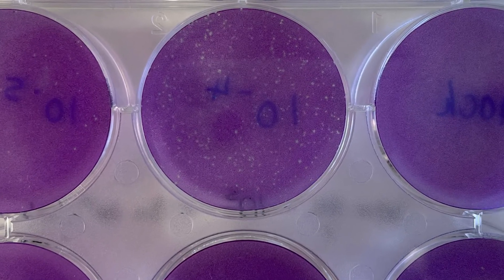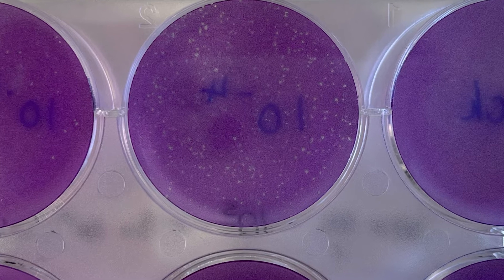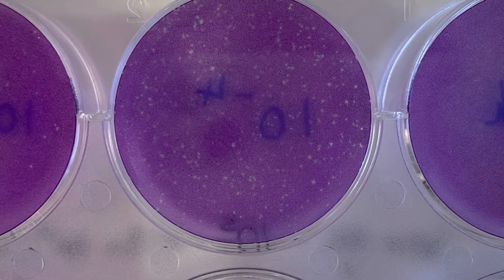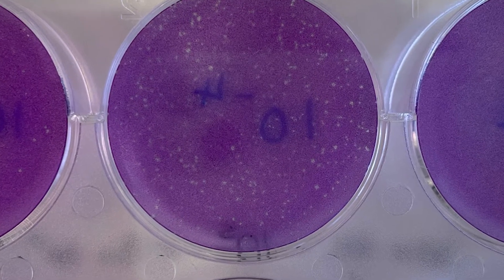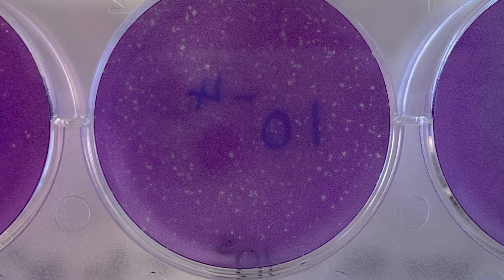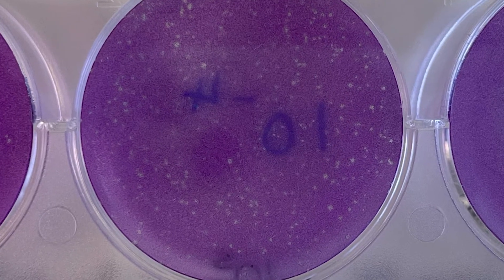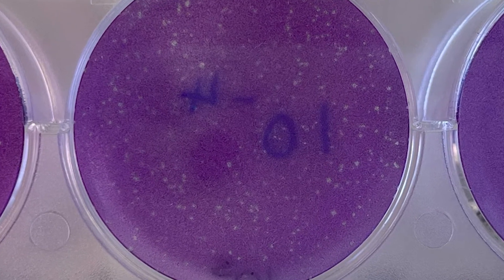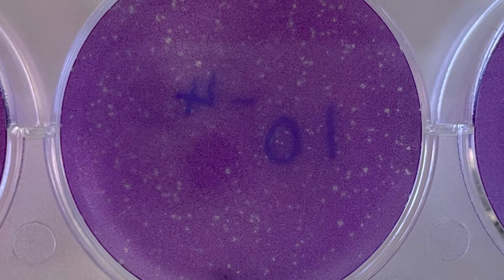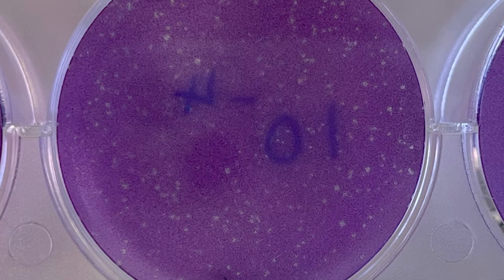For example, this plate shows plaques formed by herpes virus 1 on a monolayer of Vero cells. In this image, the cells are stained with crystal violet, making it easy to see the plaques where the virus has destroyed the cells.